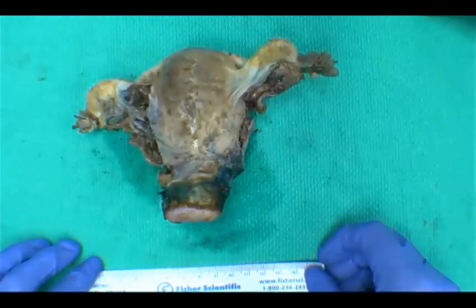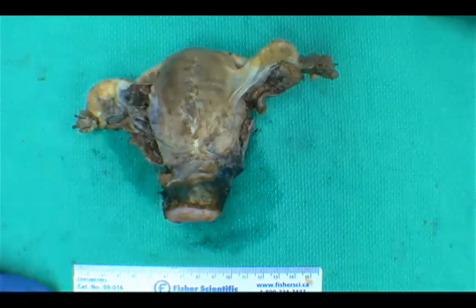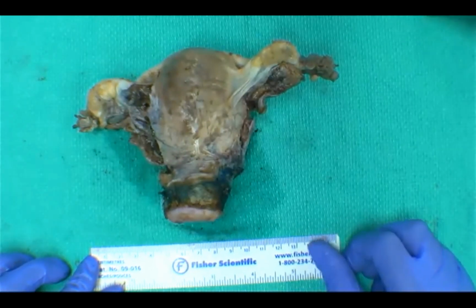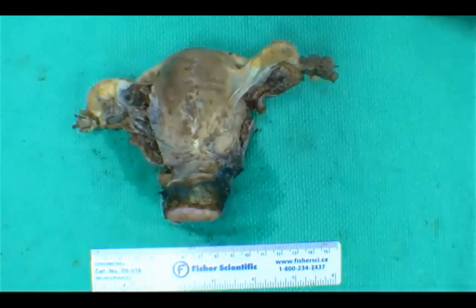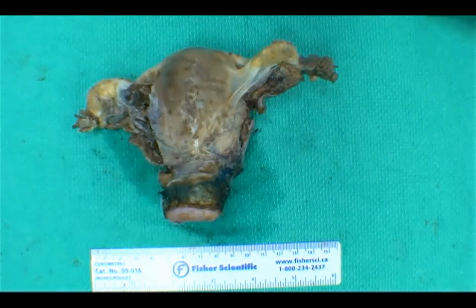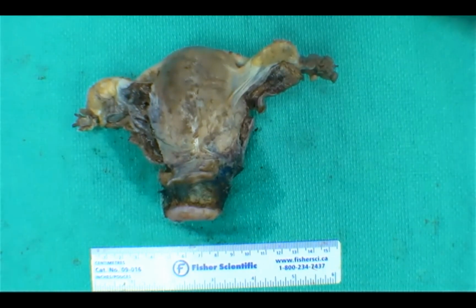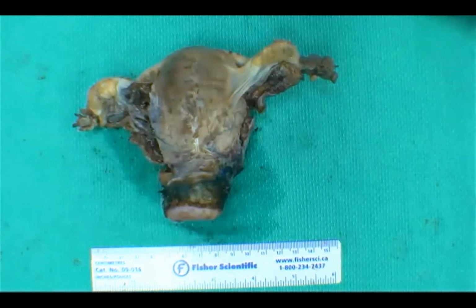Not that we're suspicious of that, but just to get to that question, there's no fat in leiomyoma classically. Absolutely, there isn't. It's a smooth muscle proliferation. That being said, though, metaplasia is very common in smooth muscle tumors, and that's why you get the ossification, right? Anything mesenchymal can potentially transform into any of them. You get some cystic change related to that.